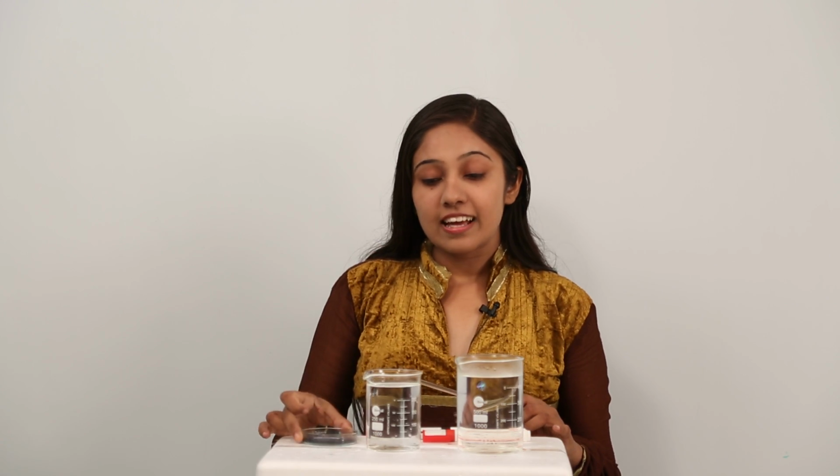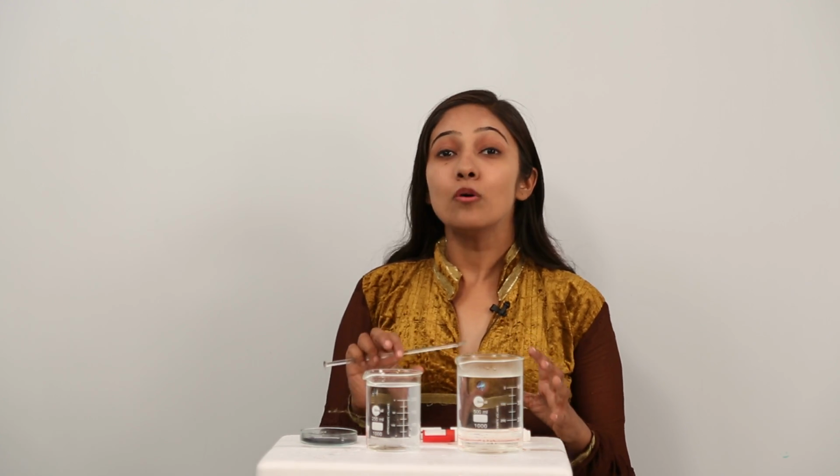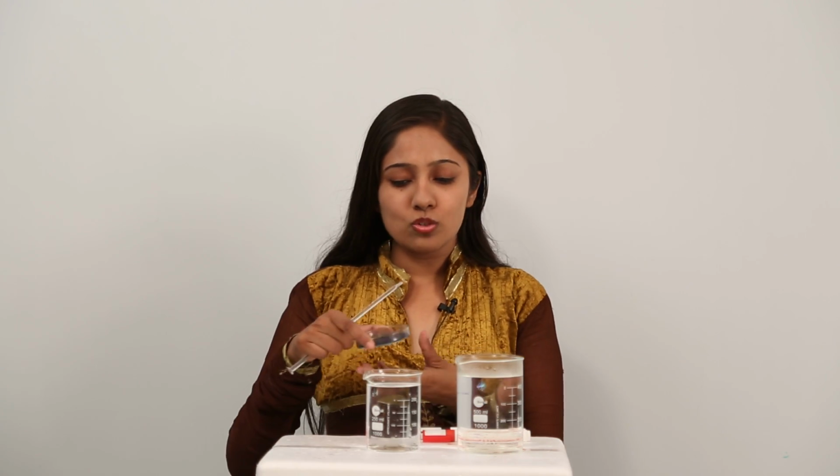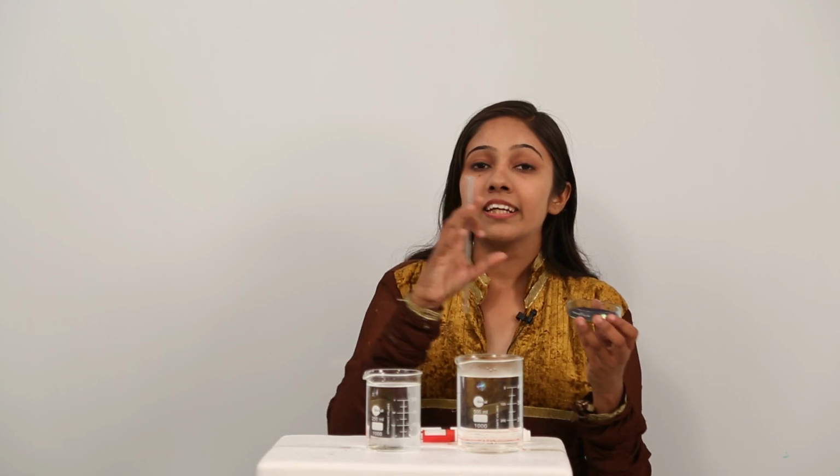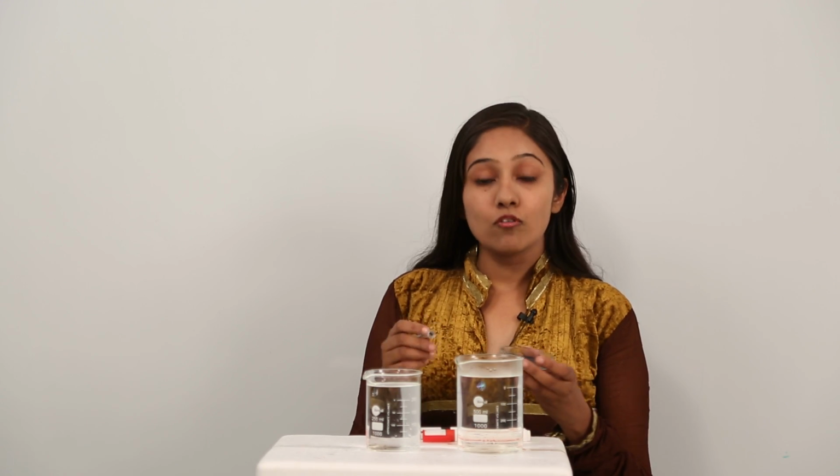For better understanding, let us perform a live activity by using potassium permanganate crystals. This live activity is going to show you how this diffusion process takes place. Why do we usually use potassium permanganate crystals in the lab? We use them because they are clearly visible. They can clearly demonstrate the diffusion process. So let us see what happens.